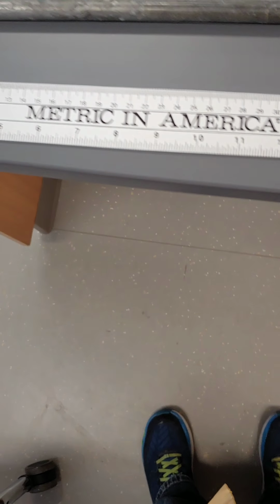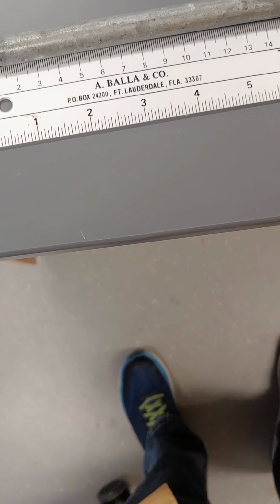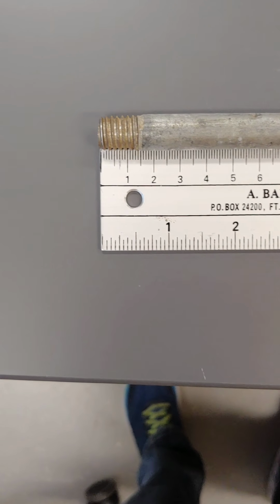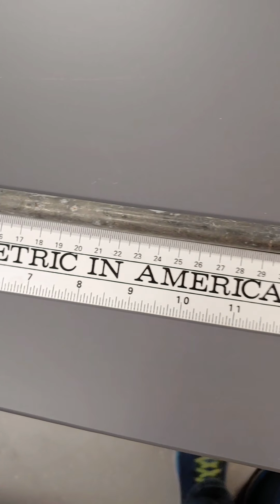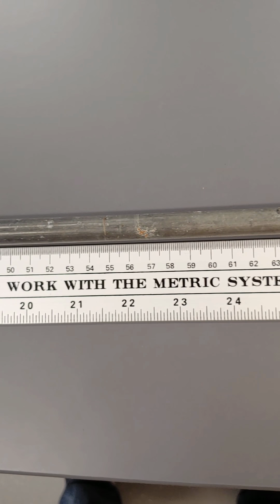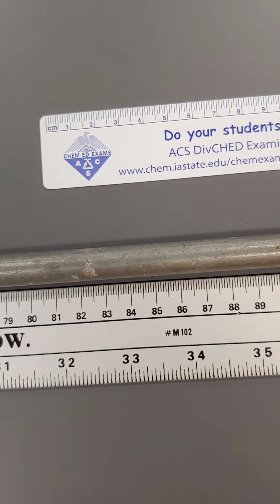So I have my Metric in America ruler. If I place one end of that like so, line those up so the end of the stick is right even with the end of the ruler. And if we measure that down, youth of today will live and work with the metric system. Ha! If only. Learn more about it now. See, there you go. All right.